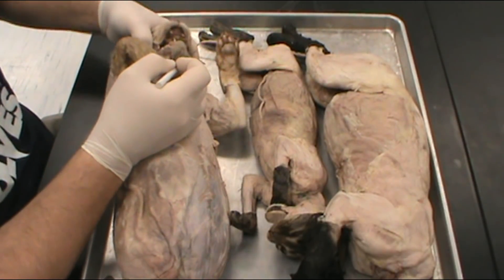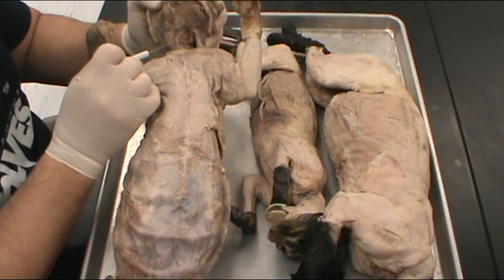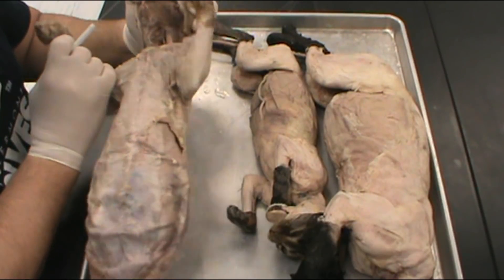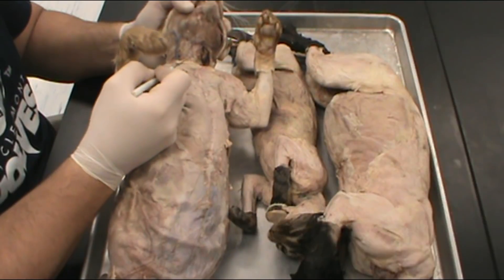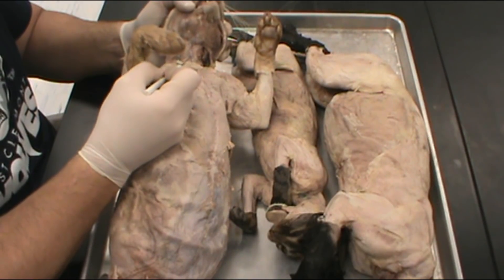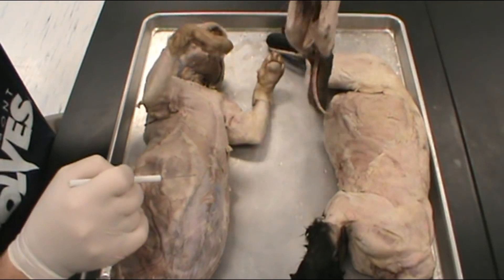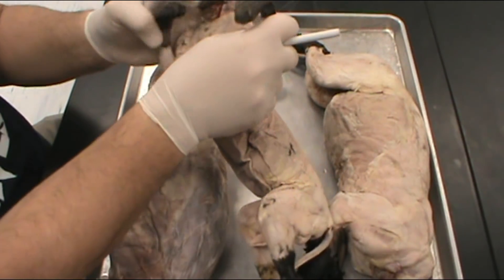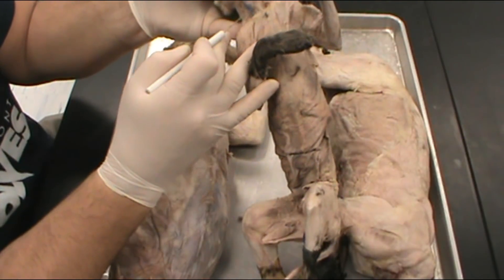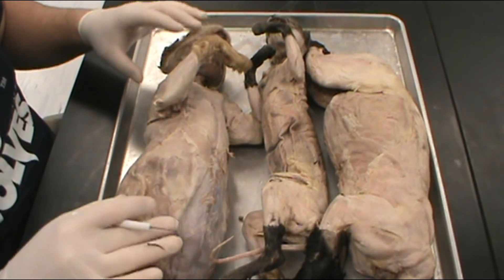The other muscle we want to look at is the sternomastoid. This one can be tricky — as you can see, they cut a portion of tissue away to access the major blood vessels to embalm and inject the colored dye into the cardiovascular system. A lot of times the sternomastoid is damaged because of that. But on this side we can see a large piece of that muscle, which makes a V that heads up to the back of the skull. On the smaller cat, we get a pretty good view — that muscle is right here, going up to the back of the skull. This muscle is the sternomastoid.